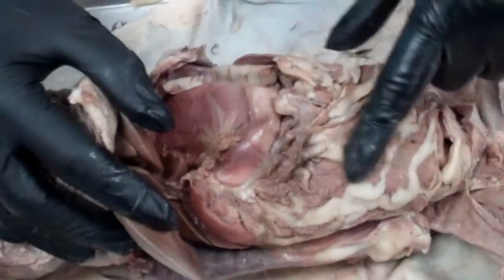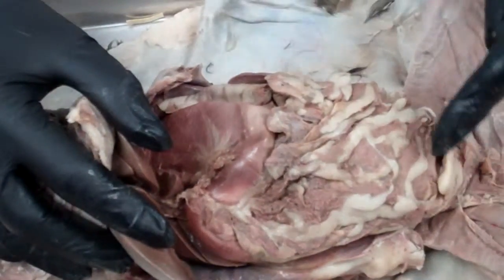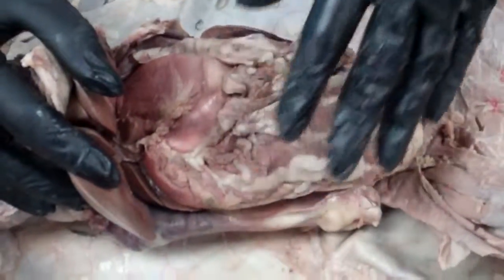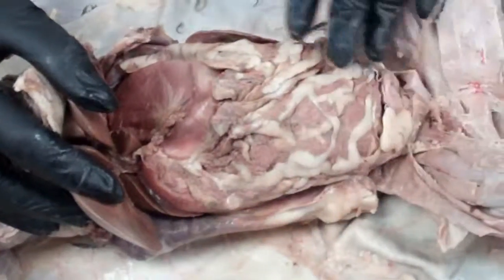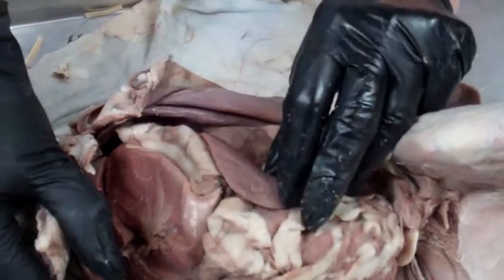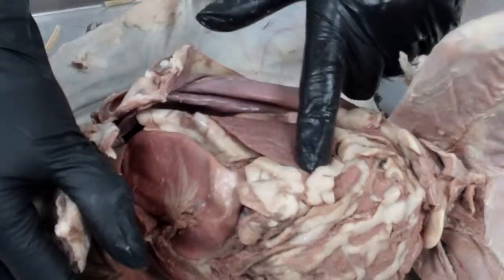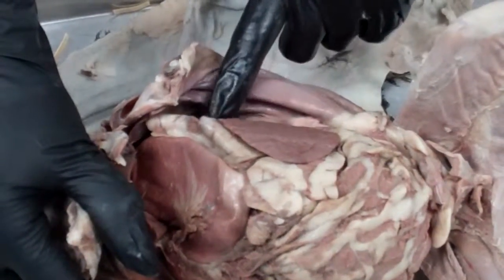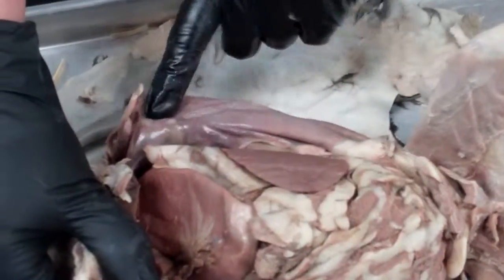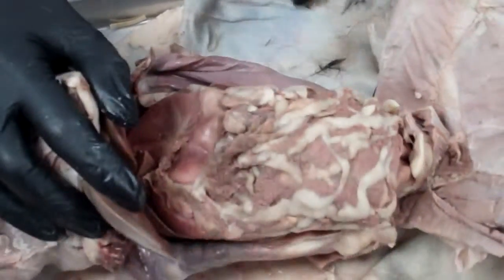Attached to that is this very large fatty structure here. This is called the greater omentum. And the greater omentum is a large fatty structure which is covering and insulating all of the intestines and abdominal organs. Over on the left side, you'll see this structure coming up here. This is the spleen. This is actually pretty much part of the immune system. It takes care of recycling all of the used blood cells, and it's similar in texture to the liver.